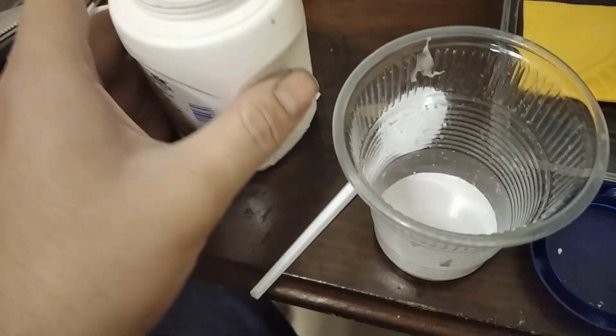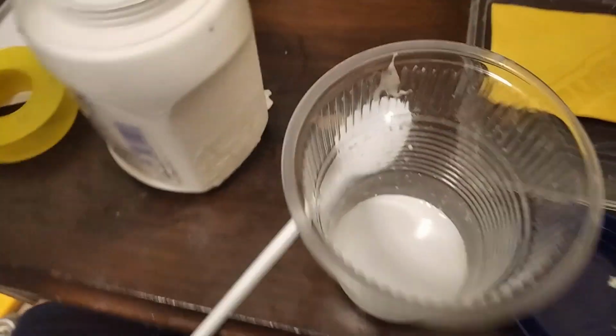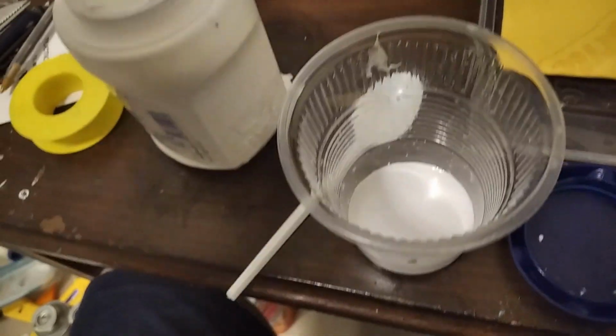Holy shit, this is slow. I need to get another spoon. Here's my second spoon. So I put approximately, I don't know how much I put. I just put.